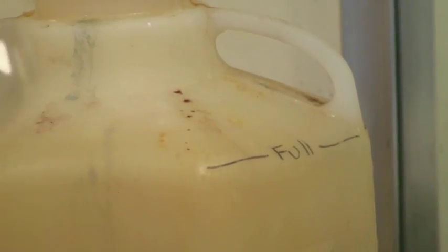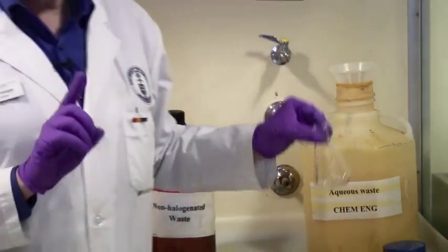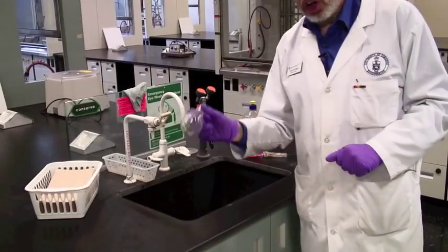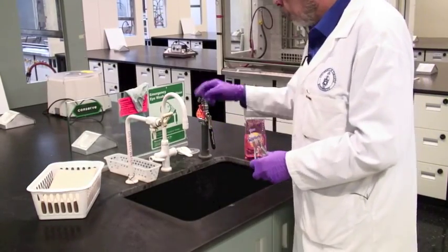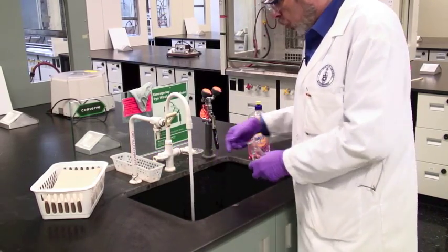However, once you've emptied it, this is dirty and you're going to need to start doing dishes. That happens over at the sink. You'll probably be doing more than one flask at a time. There are taps here. This is hot and cold water.